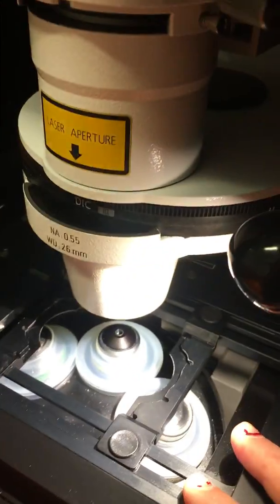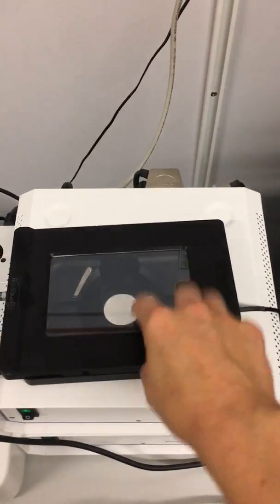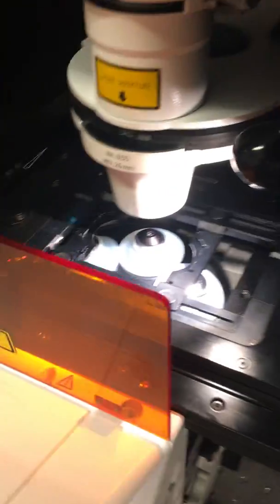So now it's in. We have a different type of frame for this microscope, and it comes with an incubator which allows you to scan your sample at different temperatures. So to mount this one, you will need to pop out the frame I just put in position.